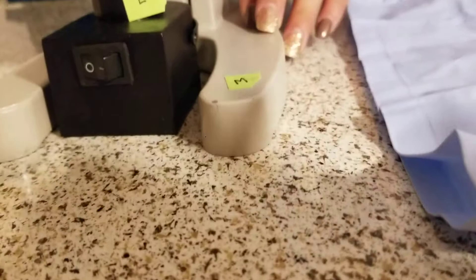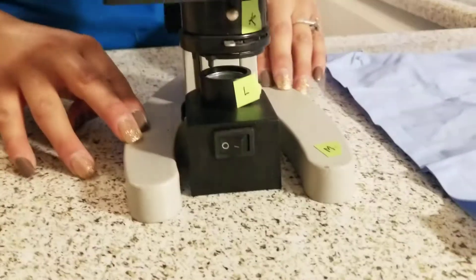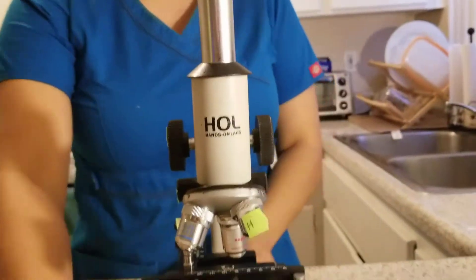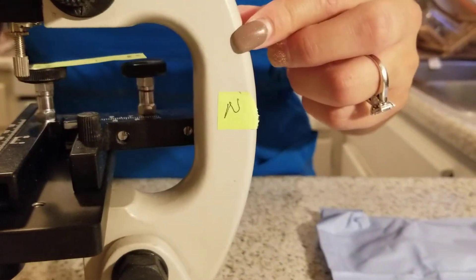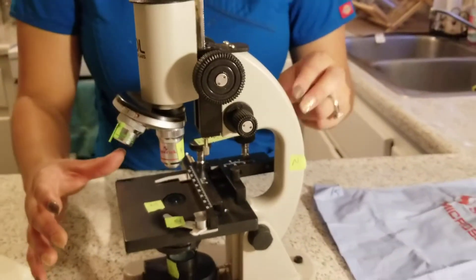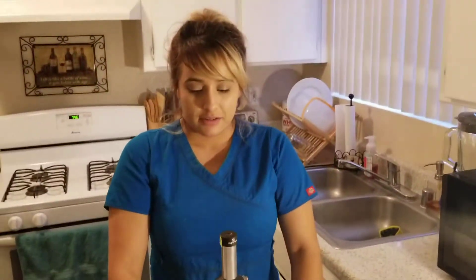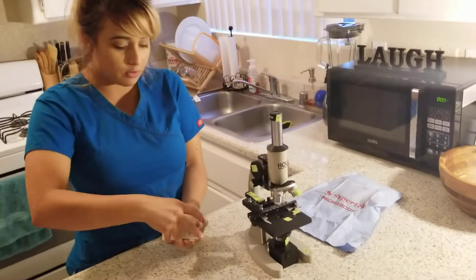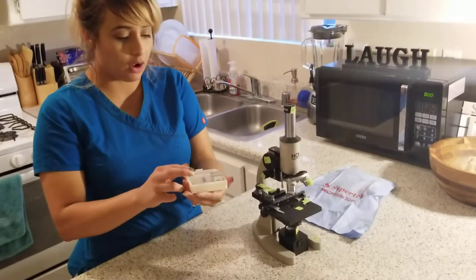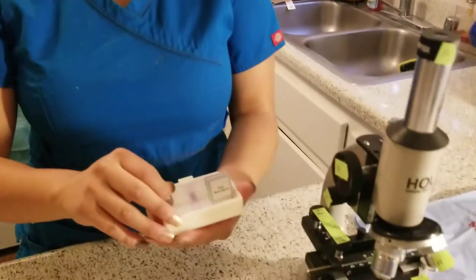Then I have M, which is the base on the bottom of the microscope that provides support to the whole instrument. And then lastly, I have N, which is the arm of the microscope that supports the lenses and connects to the base. So that'll be the microscope I'll be using to view all my slides. This is the case we've been given to view slides of different bacteria. That concludes the lab. Thank you.